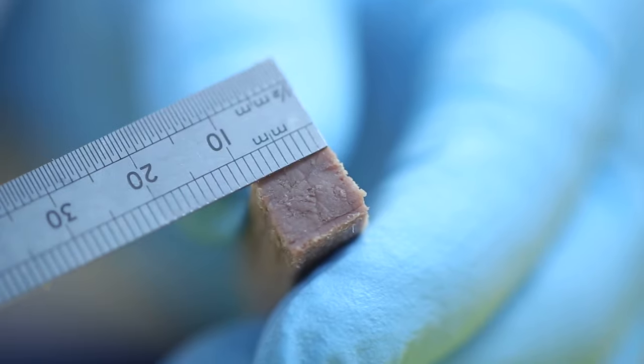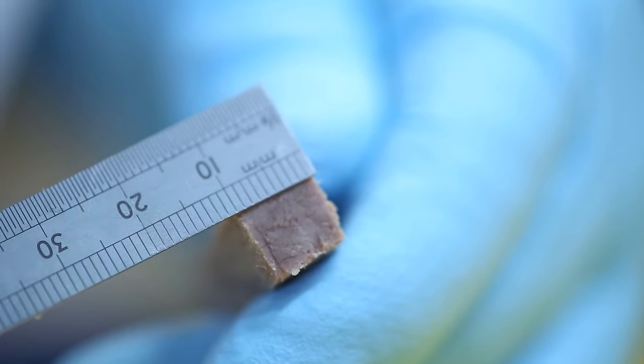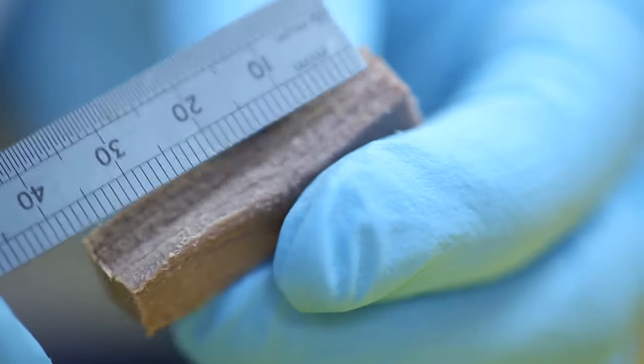Fibre direction is key to achieving valid results. Ensure that the fibres are running along the length of the sample so that the blade can shear across them.